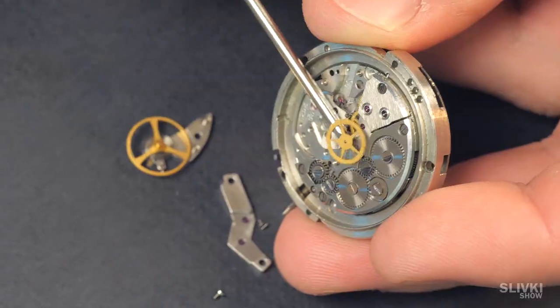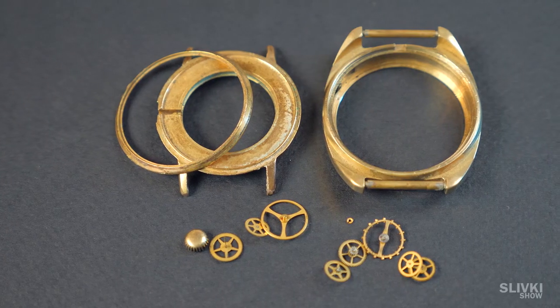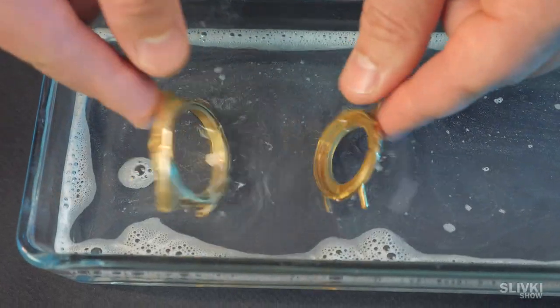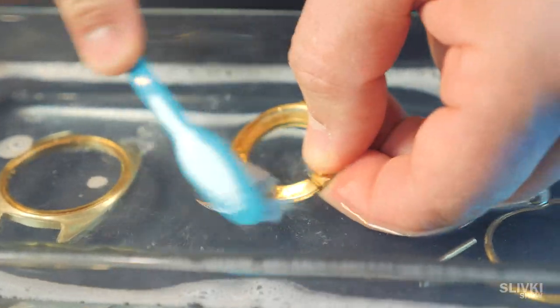We did the same process with the other watch. We got a few details with gilding. Taking a little bit of water with cleaning liquid, we cleaned it from dirt.